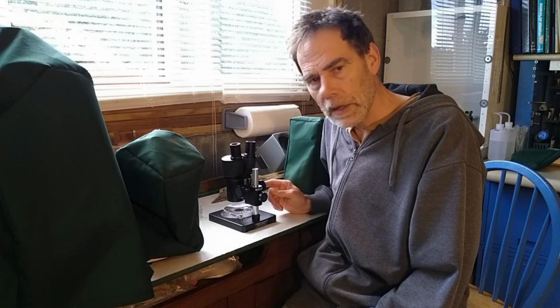The first thing that I've done is I've ground up the sample and I stuck it under a stereo microscope. I just wanted to get a quick look at it. And there seems to be a fair number of fractures that are at a right angle. And that would be indicative of a cubic or isometric crystal system. And that would include galena and pyrite, but not the chalcopyrite, which I believe is tetragonal.